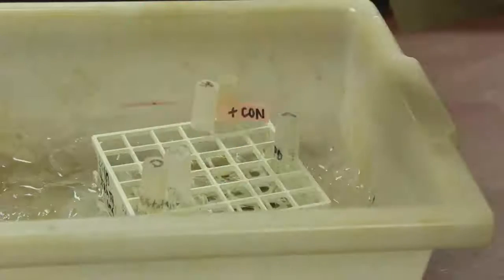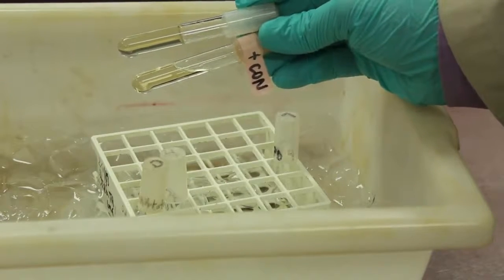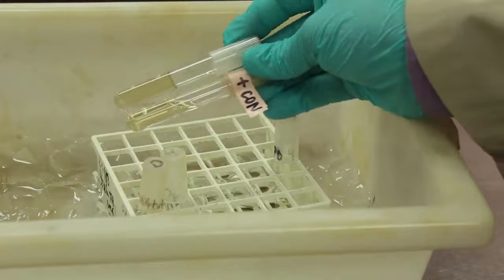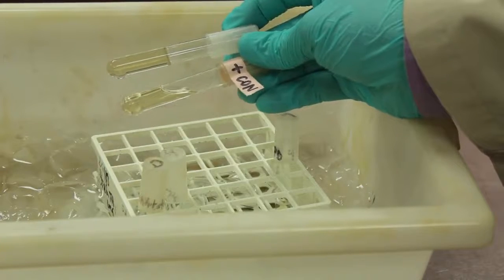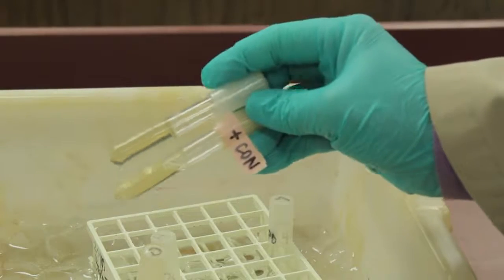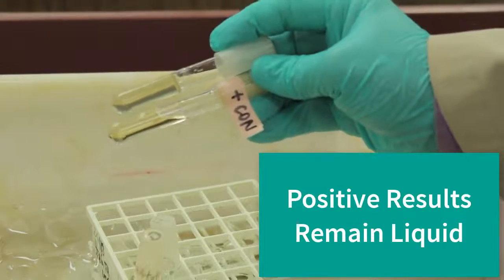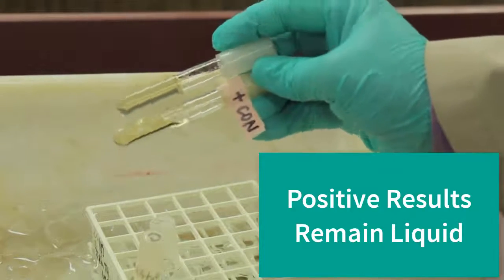At the end of 30 minutes, I would compare my tube to the control tube, the positive control tube. Now, when I lift it out, notice the test tube has solidified once again and the positive control tube remains liquefied. If you have a positive gelatin result, your tube will not re-solidify. It will remain liquid.